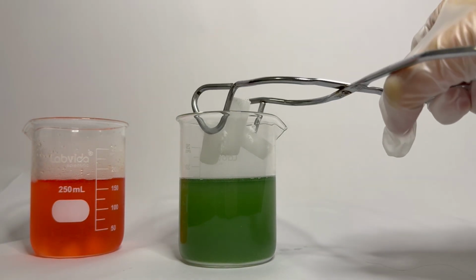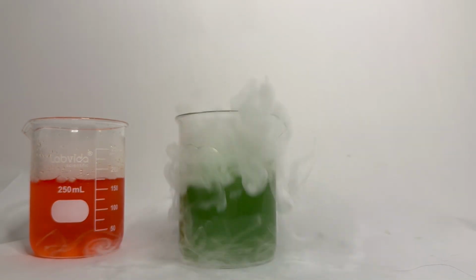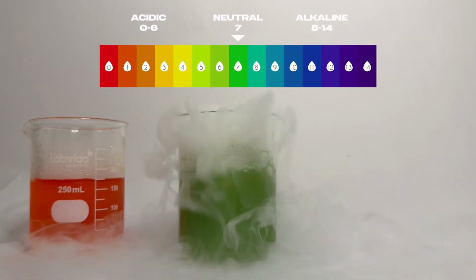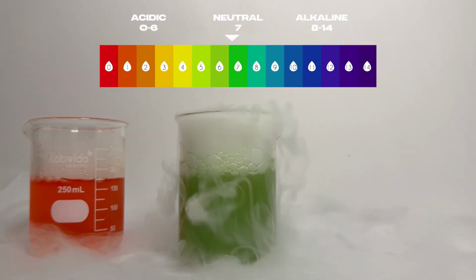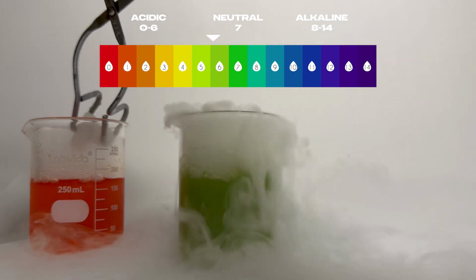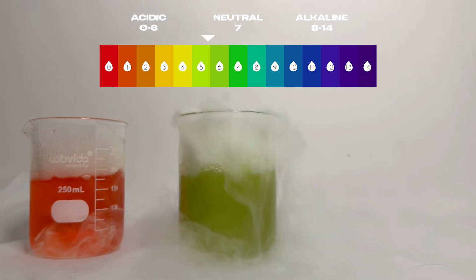Ironically though, I got a smaller range of colors because all that happened was it ended at a higher pH than the one without the baking powder did. So essentially it looks like it started around a similar pH, but it ended at a much more basic pH compared to the water, which makes sense.